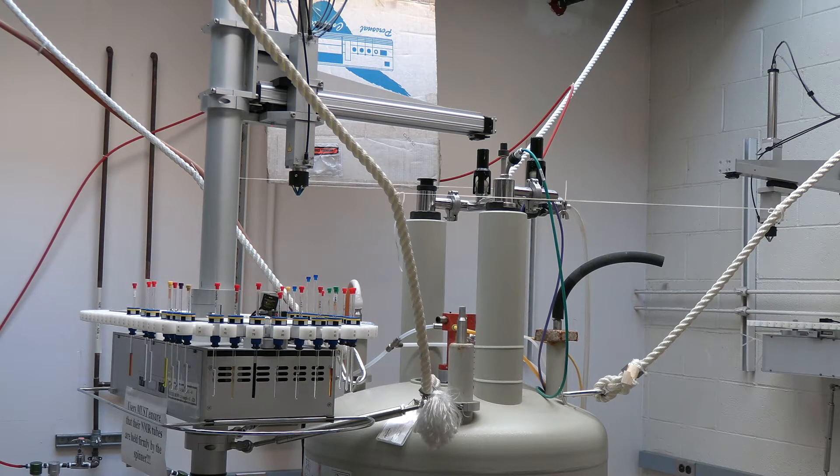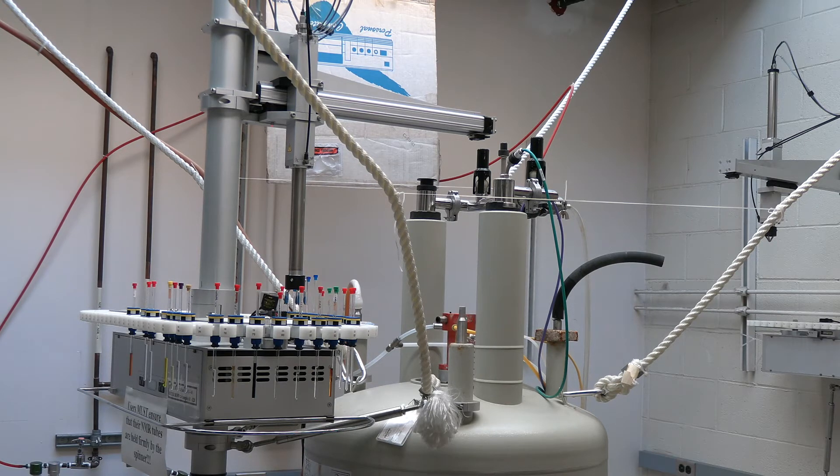Welcome to the AV400 sample changer training. Today we will be going over how to prep your samples, place them on the sample changer, and set up your experiments.